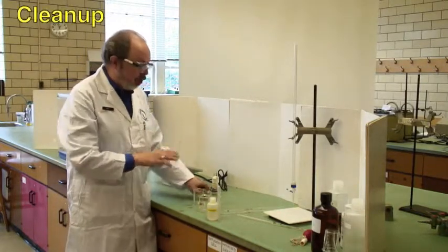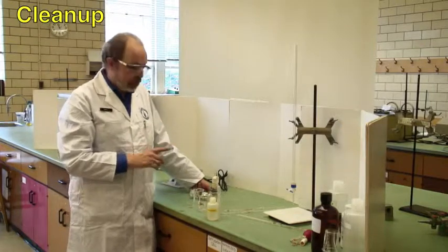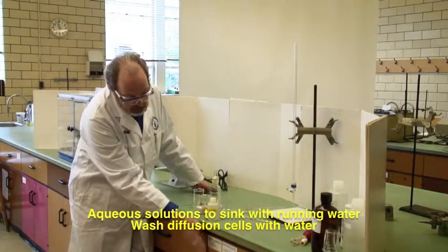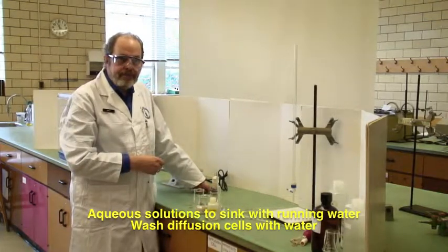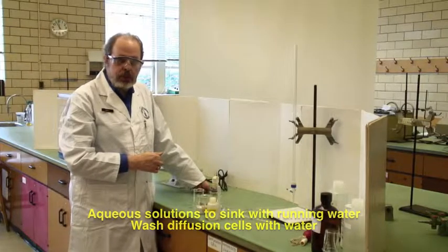In terms of clean up, all of these solutions can go down the sink with lots of running water. Make sure that you wash these out, and they are stored back in the drawer. And that's how you do experiment E2, which is diffusion through a membrane.